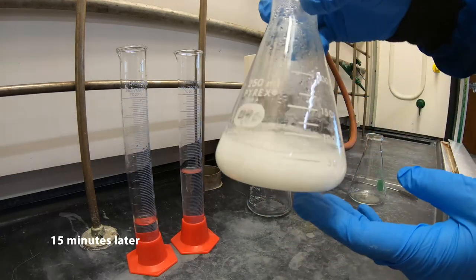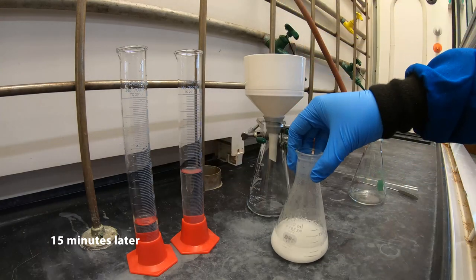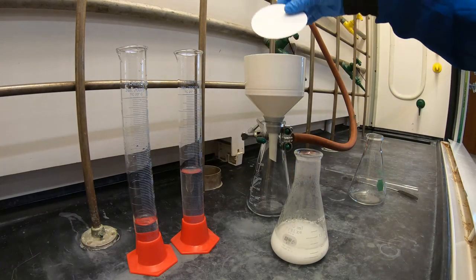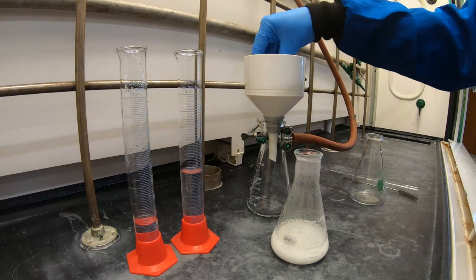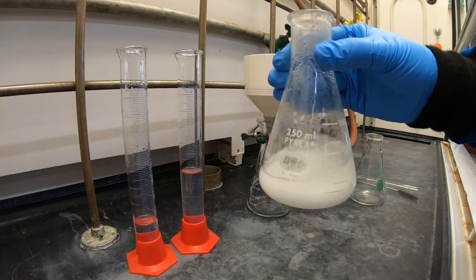During this 15 minute wait, set up your vacuum filtration apparatus. Now you're going to filter the white solid that has been produced during the reaction.